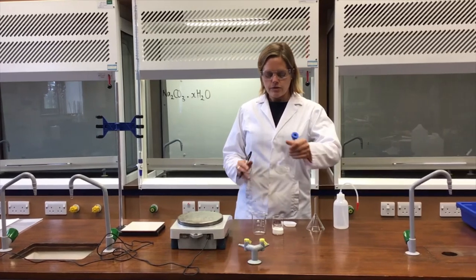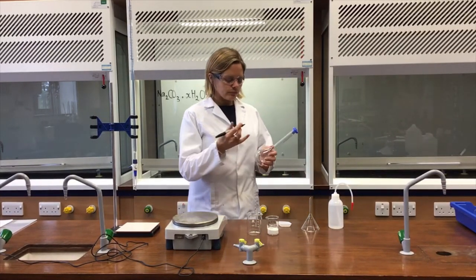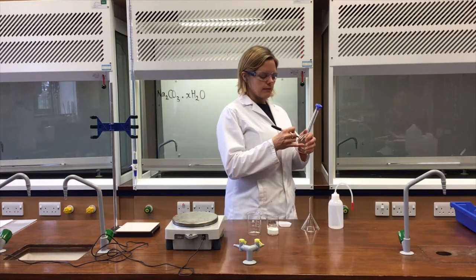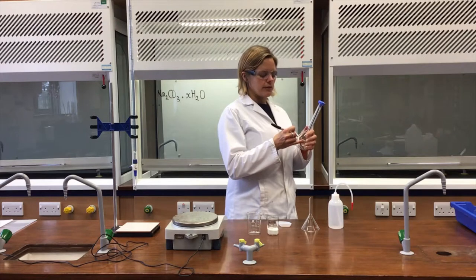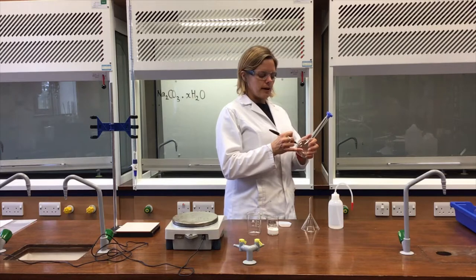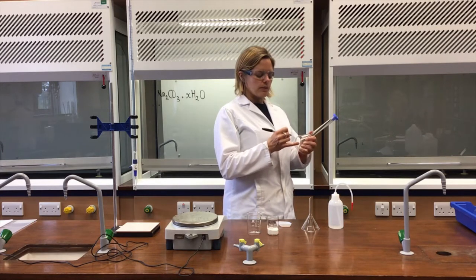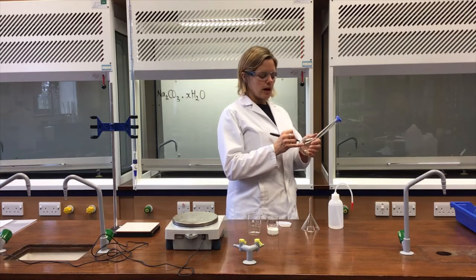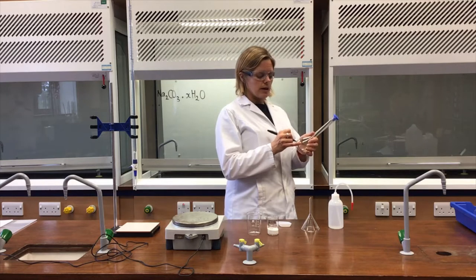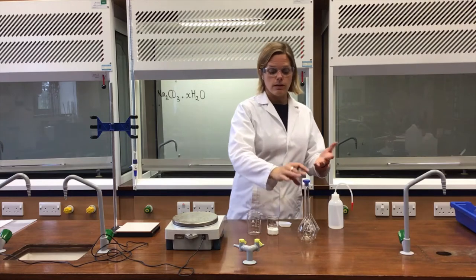Experiment A2 covers the remainder of the first of the required practicals. I'm going to make up a solution containing sodium carbonate. Before I do anything else with this flask, I'm going to label it with my name, what it contains, the approximate concentration (to be filled in later), and today's date, so that the flask is now allocated to me and my solution.